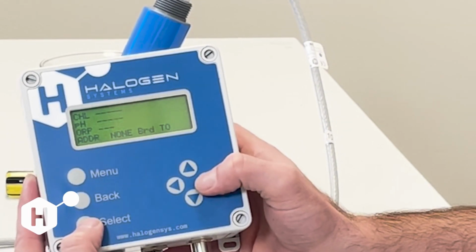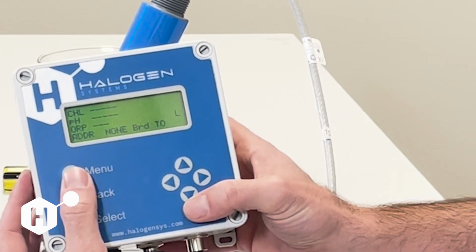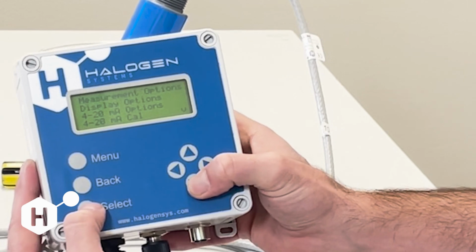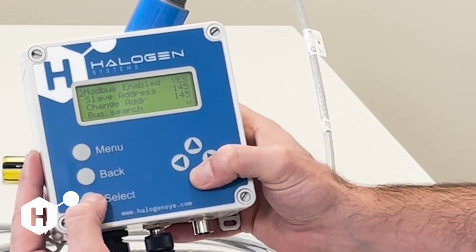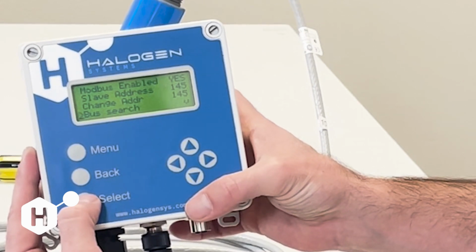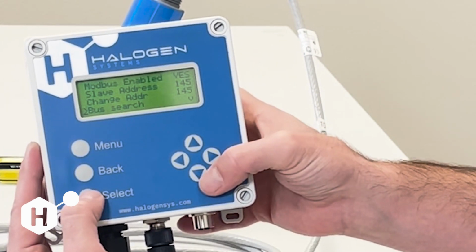To activate the long menu, you're going to hold select and right arrow for at least 2 seconds. And then we're going to go to menu, configuration, Modbus options, and we're going to go down and run a bus search. Basically, this bus search is going to do exactly what the display does on startup, and it's going to cycle through addresses 125 to 144 to establish communication with the sensor.